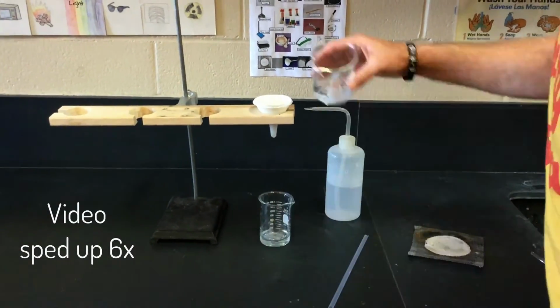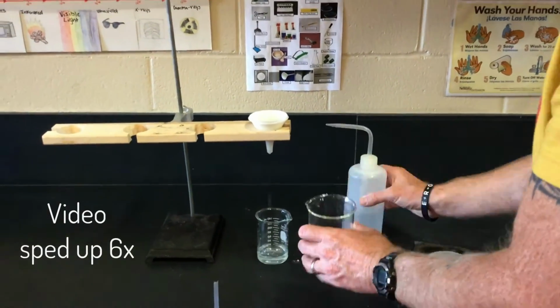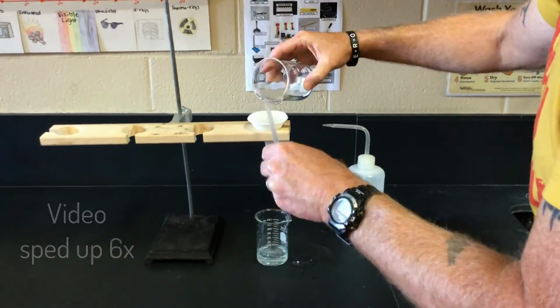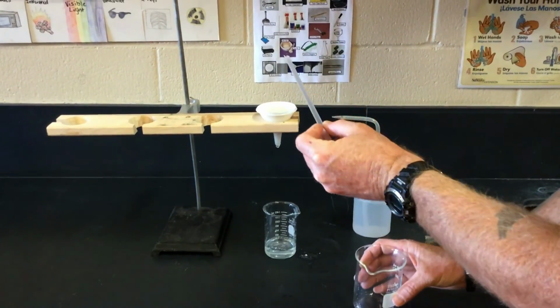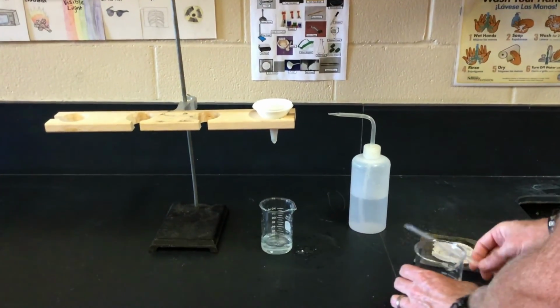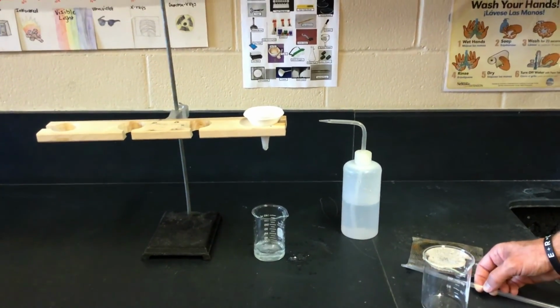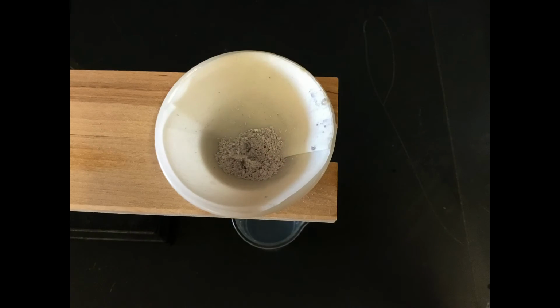It is very important that we get all of the solid out of this beaker. So we're going to do a couple rinsings with distilled water and scrape all the solid out of the beaker that we can with our plastic spatula. After gravity has assisted all of the liquid through the funnel, our new solid, AgCl, will look like this.